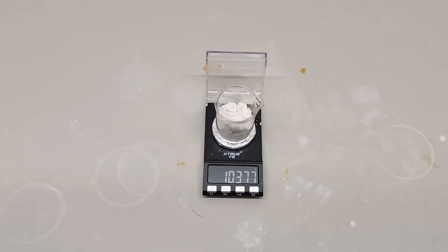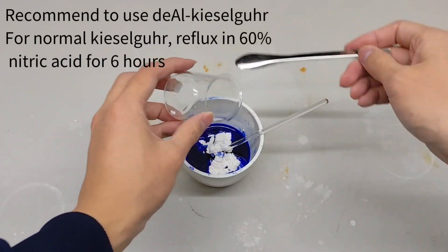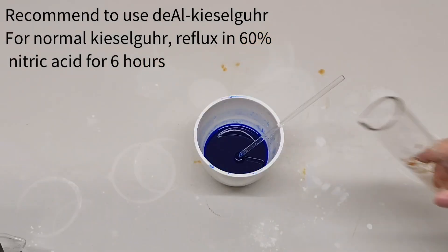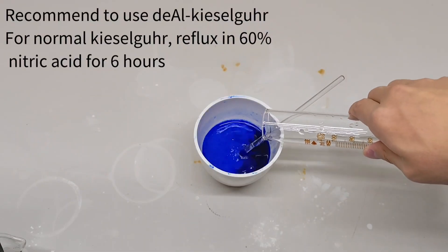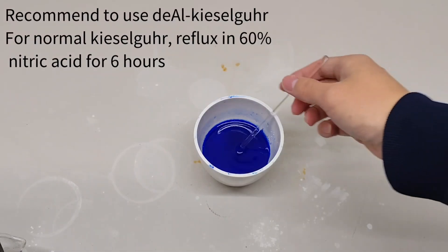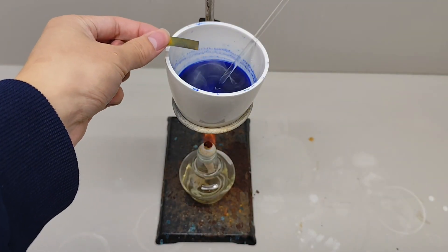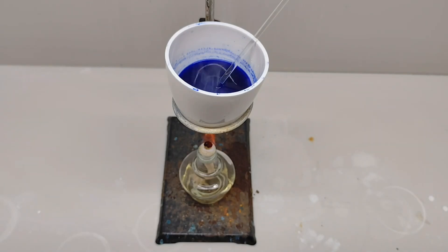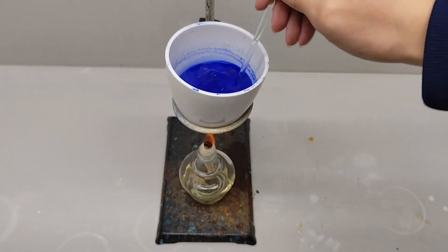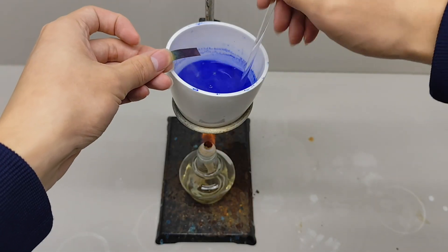When ready, I add about 9 grams of kieselguhr and stir for another 30 minutes. There should not be any alumina in the kieselguhr, or it would decrease the yield. If you buy normal kieselguhr, it should be refluxed in 60% nitric acid for 6 hours before use. I bought kieselguhr without aluminum, so I skipped that step. I then heat it until boiling, remove it from heat, and let it cool down so the copper acetate impregnates the kieselguhr. There is no need to worry about ammonia escaping — there is still plenty in the solution.